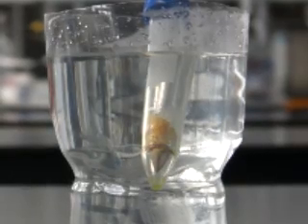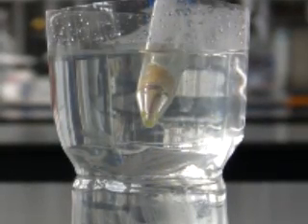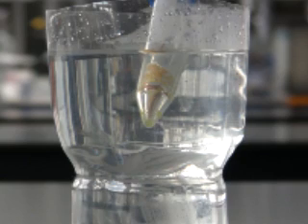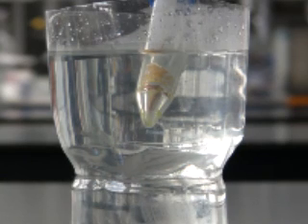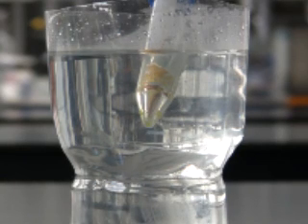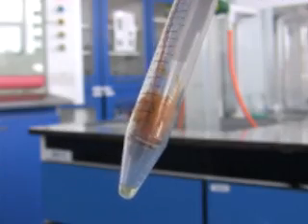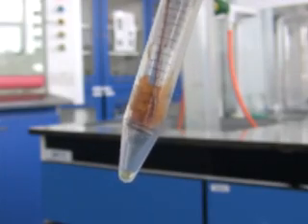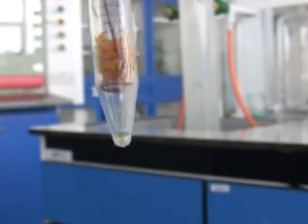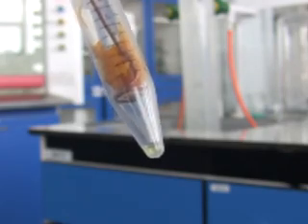Eventually all of the carbon dioxide escapes through the cap as the tube deforms slightly under pressure. More carbon dioxide can be added to perform a second extraction to improve the yield. Finally, after the tube has warmed up to room temperature, you can see that we've collected a significant amount of limonene in the bottom of the tube.